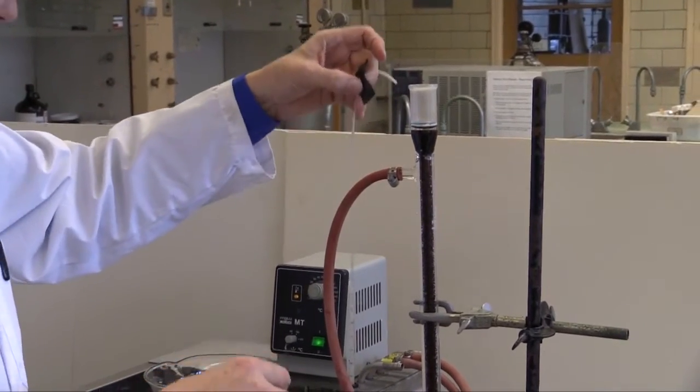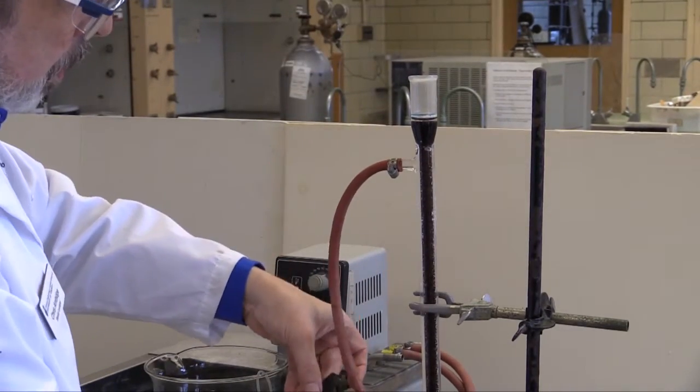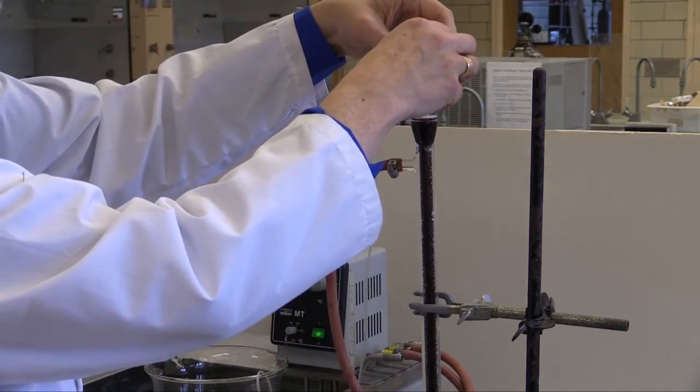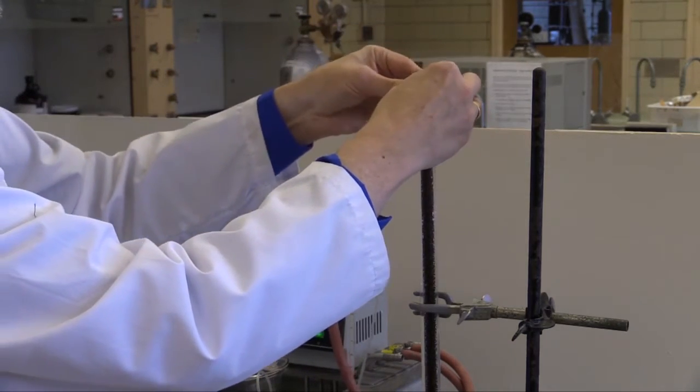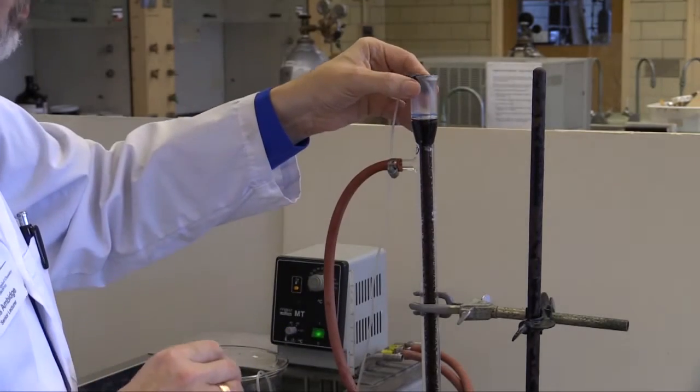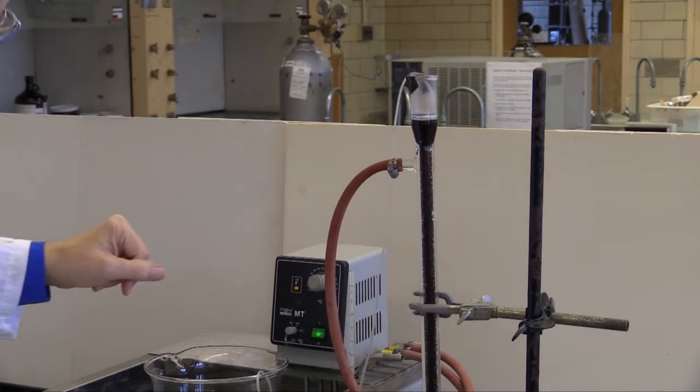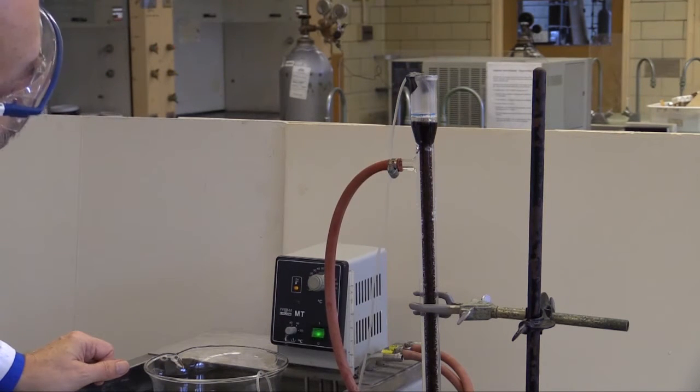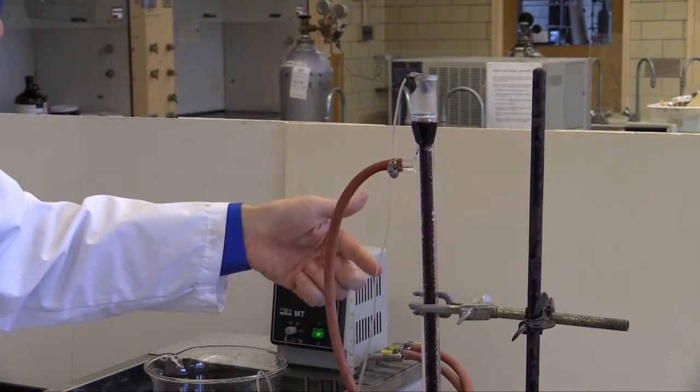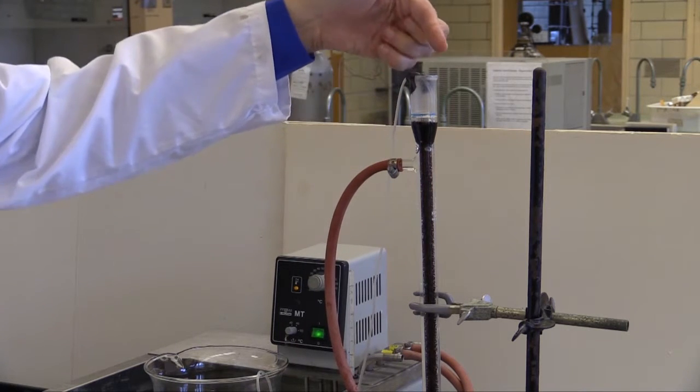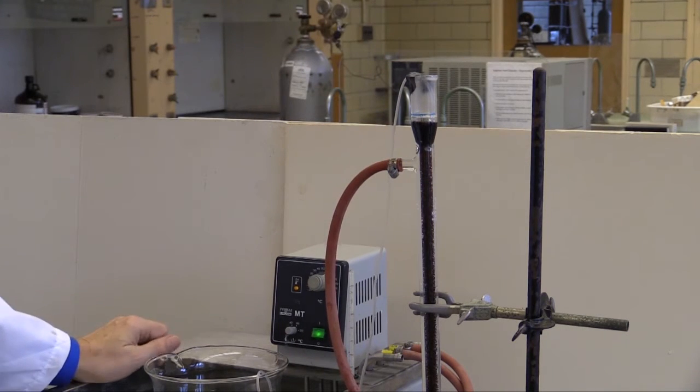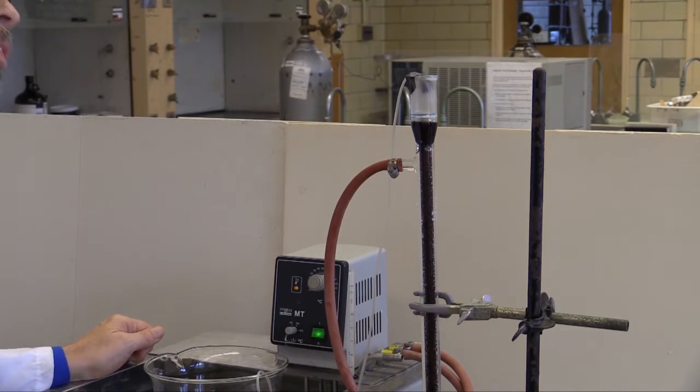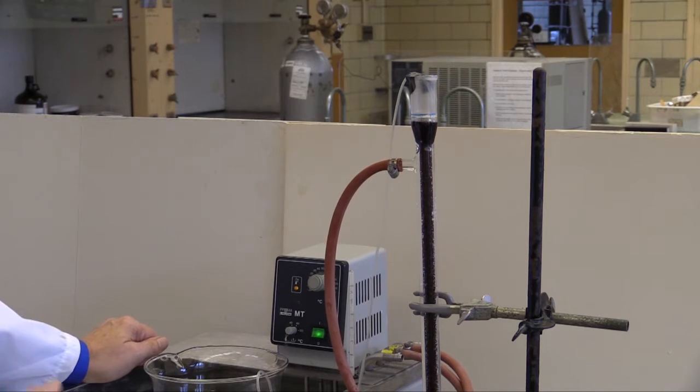Take the output of the peristaltic pump, preferably not tangled up, place it inside the cap, and use some electrical tape to hold it in place so it's not falling off. And at this point, we'll turn the pump on. And we've now got liquid coming up the tube and into the top of the reactor. And this will keep liquid flowing through for as long as the reaction needs to be taking place.